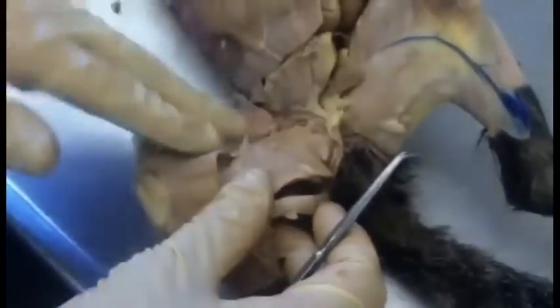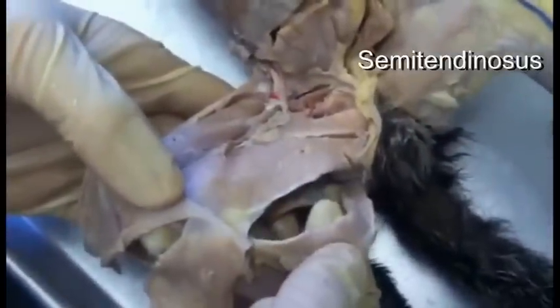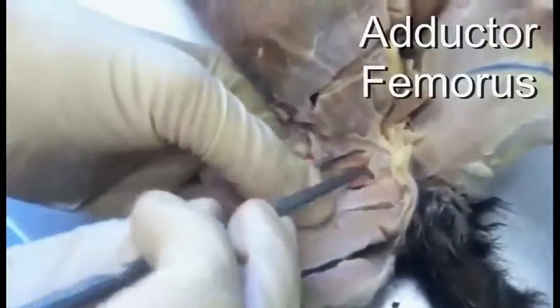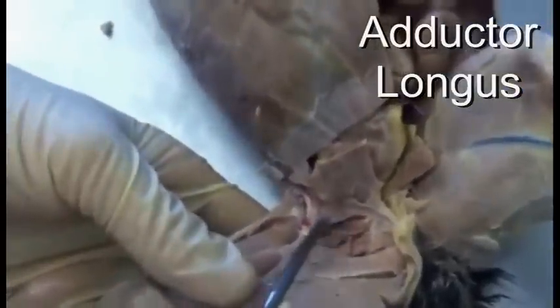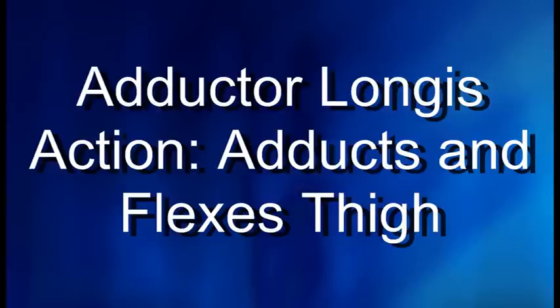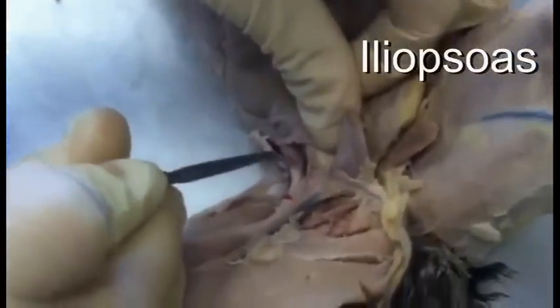Now the ventral thigh muscles. There are two big superficial muscles: sartorius and gracilis. When you cut and reflect them, they expose another group of muscles: semitendinosus, semimembranosus, adductor femoris — which is one muscle despite two divisions — and adductor longus. This small one is the pectineus. And then there is another muscle that runs perpendicular to the rest, and that's the iliopsoas.